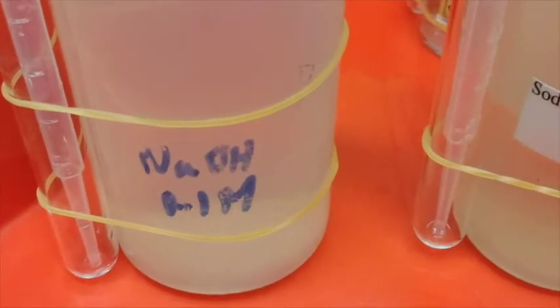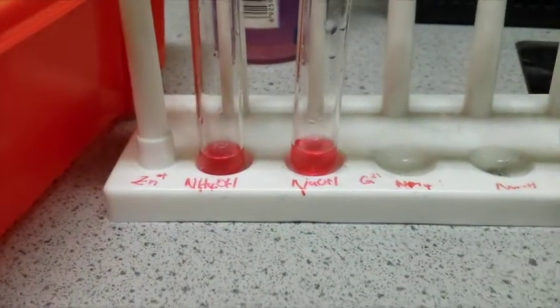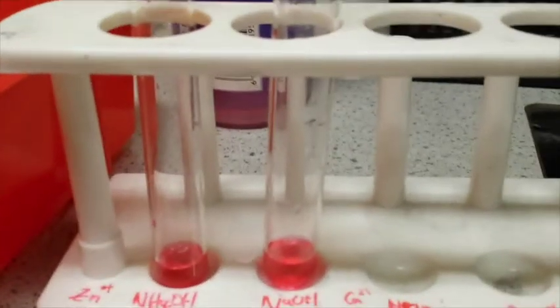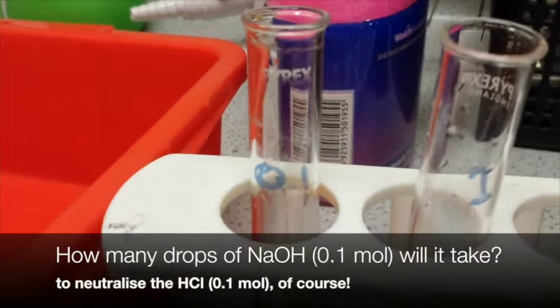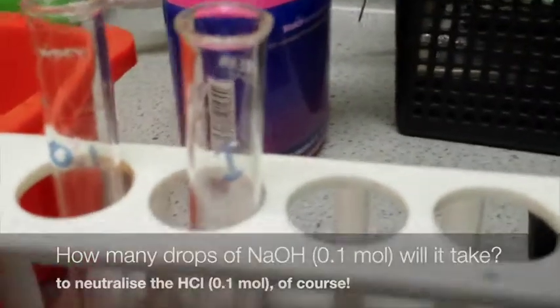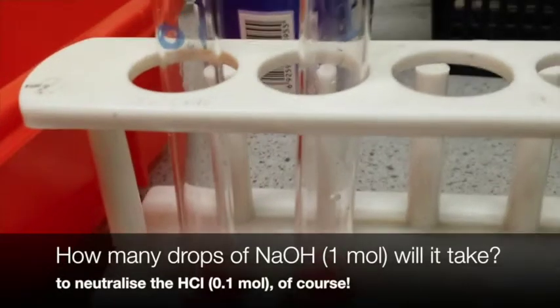So let's do an experiment to prove or see if our hypothesis is correct. We have here the two 1 milliliter test tubes of 0.1 hydrochloric acid, and what we're going to do here is, in one test tube, I'm going to count the number of drops of 0.1 sodium hydroxide it will take to neutralize this, and how many drops of the 1 mole sodium hydroxide it will take to neutralize this hydrochloric acid.